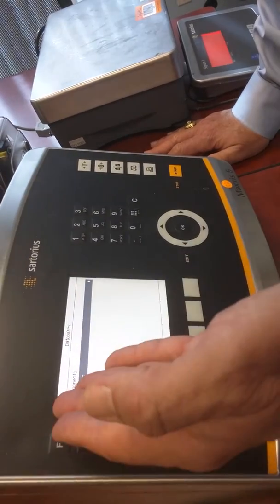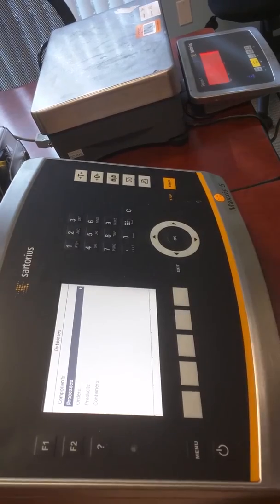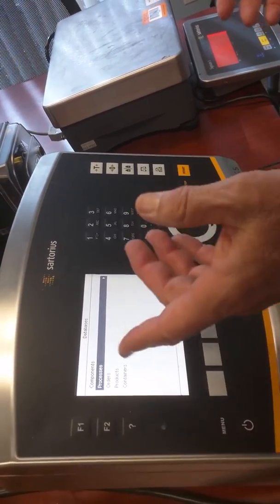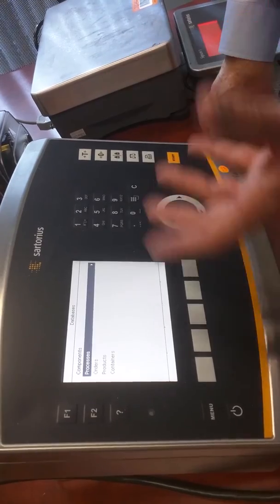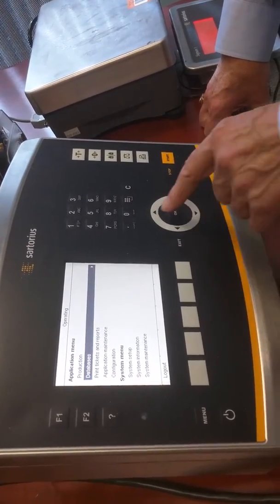So those are components. Components say how you're going to run it. Are you going to run it at one speed the whole time? Are you going to change speeds? Are you going to change once? Are you going to change twice? What are you going to do? And then the process just names, okay, we're going to do a 100 mil fill or a 2 liter fill or whatever it is you're going to do. So exit and go to production.